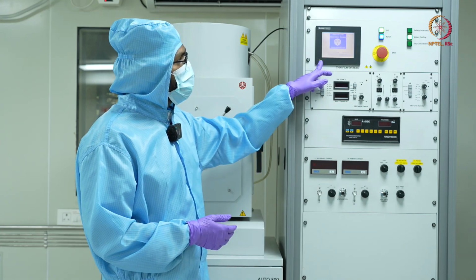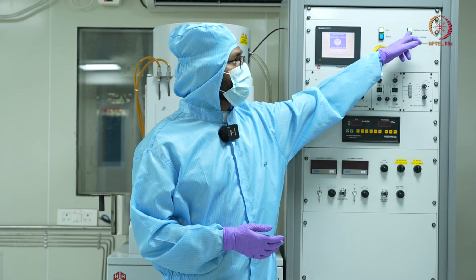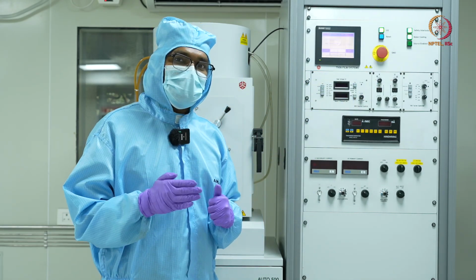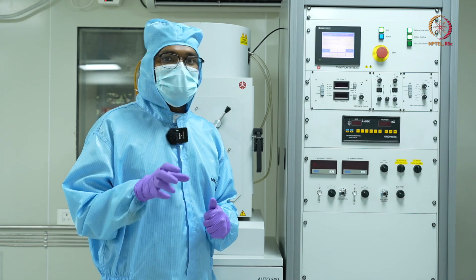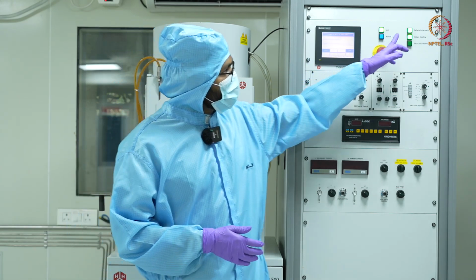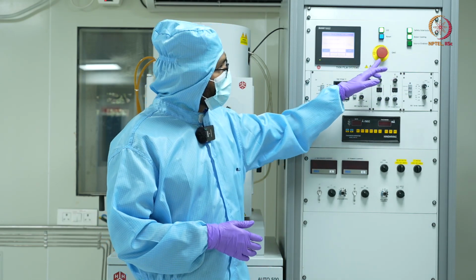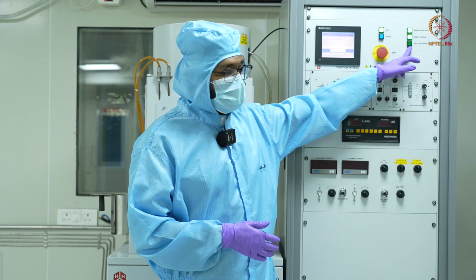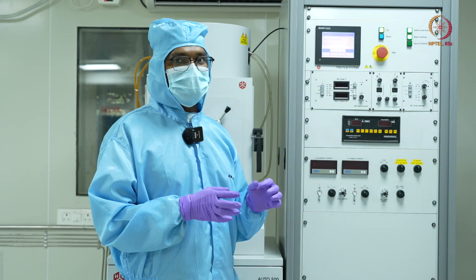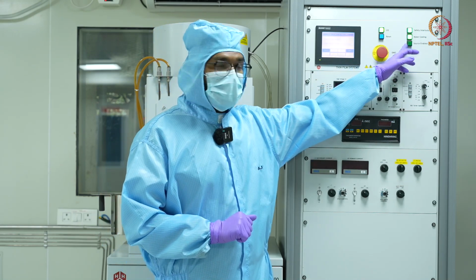Now, once the display comes, I'll click on the hardware reset, and you can see the safety interlocks are on. That means all the doors of my tool are properly closed, and also my system is under vacuum. Okay. So now you can see there is the water cooling option. That means the water cooling is happening properly, and the source enable is off right now. Basically, the source is the source for the electron beam, which is off right now. And once the deposition starts, it will start glowing.